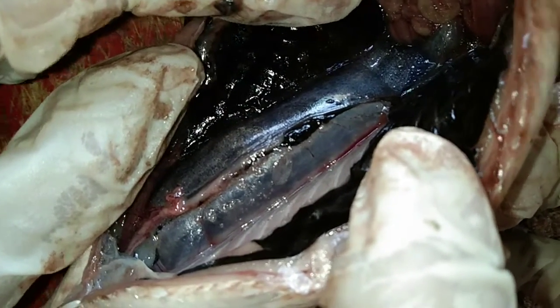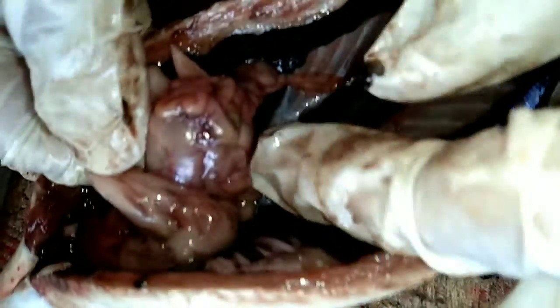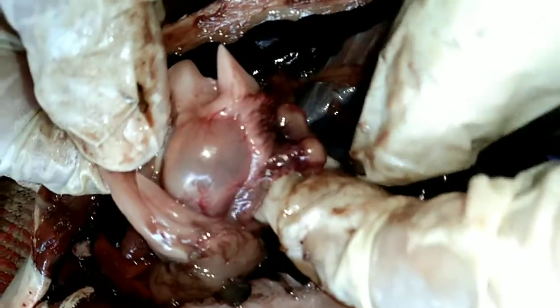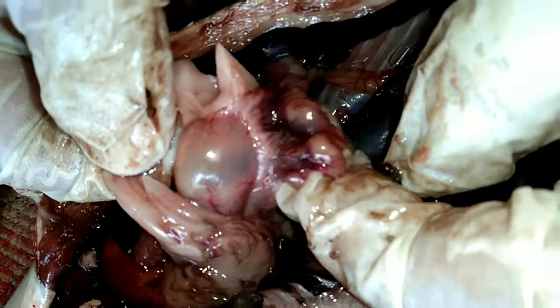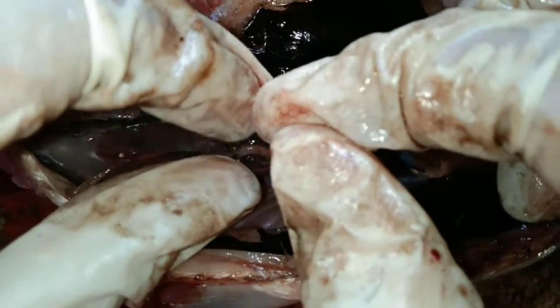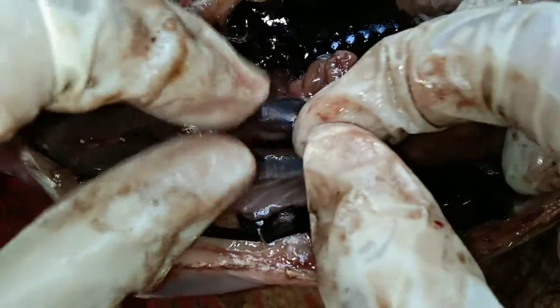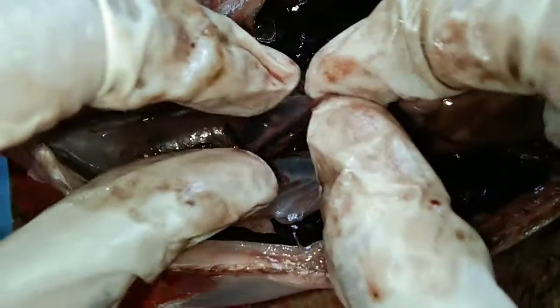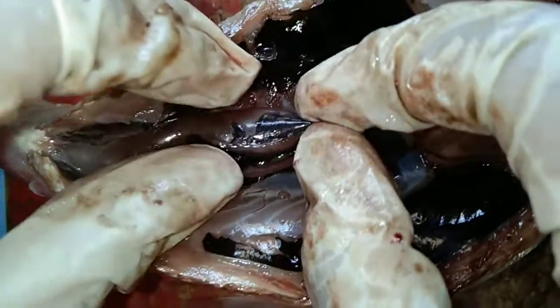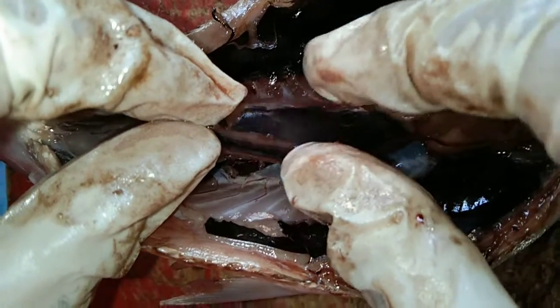These are the intestine and the stomach of the fish. They break down food and absorb nutrients. These are the gonads — the reproductive system of the fish, used to reproduce.